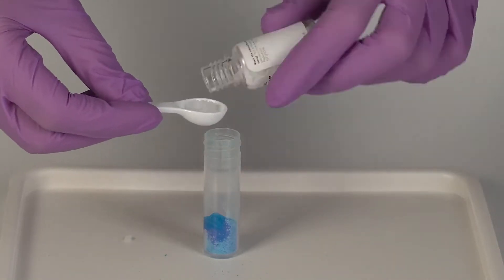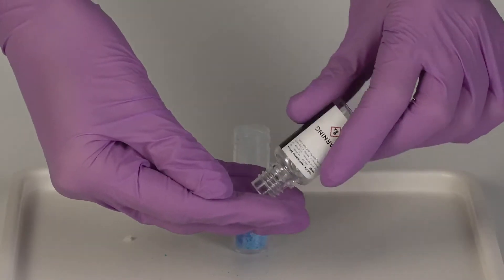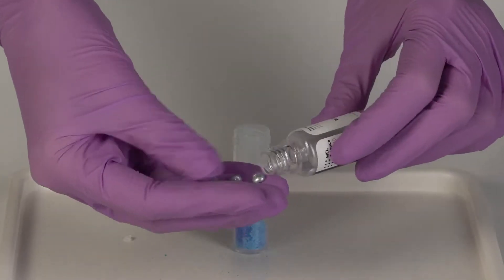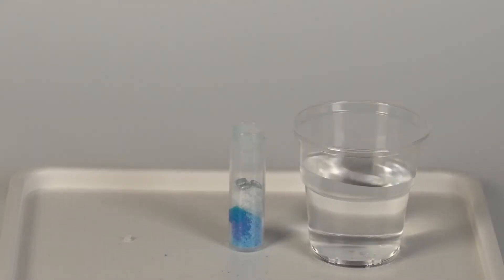Then add three big spoonfuls of sodium chloride. Take three zinc pellets and place them on top of this mixture. Add about 30 to 40 drops of water to moisten the sodium chloride.